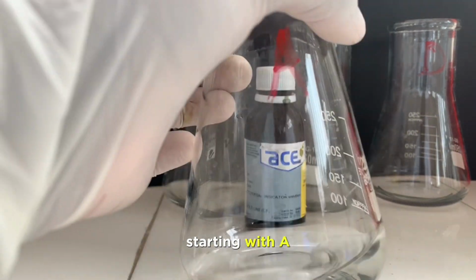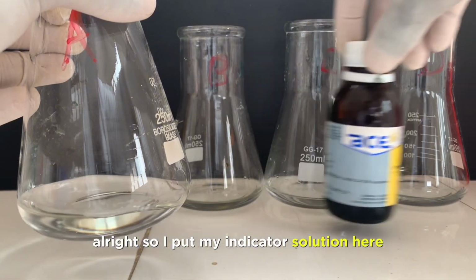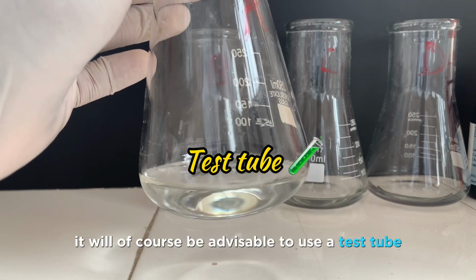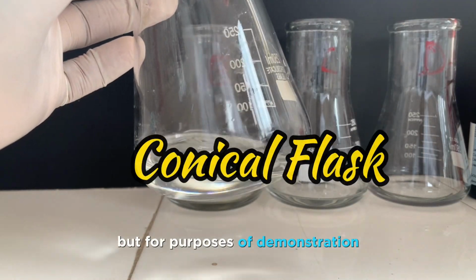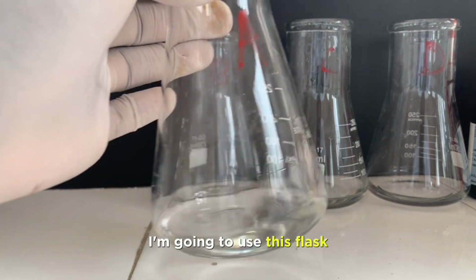and we're going to start with A. Then we'll take note of the color changes. So I put my indicator solution here. It will of course be advisable to use a test tube, but for purposes of demonstration, I'm going to use this conical flask. Alright, take note that all these solutions are colorless.